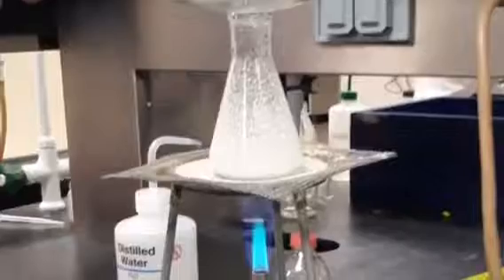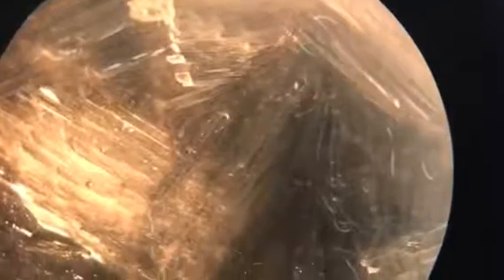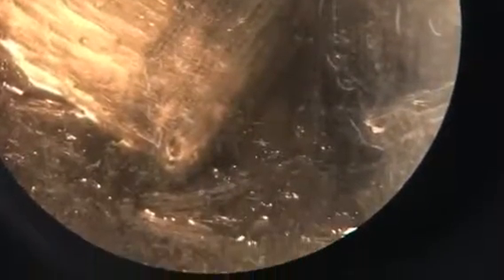Objective: separate by the crystallization method the components of different mixtures and compare the physical characteristics of different crystals. Mix potassium nitrate and silica in a glass with hot water. Filter without cooling and crystallize the solution by evaporating water partially. Analyze the crystal form of potassium nitrate.